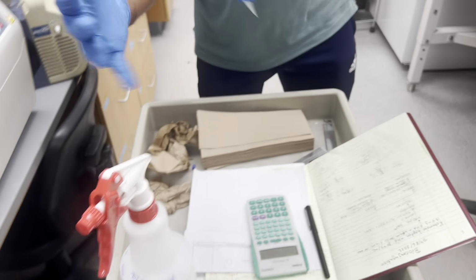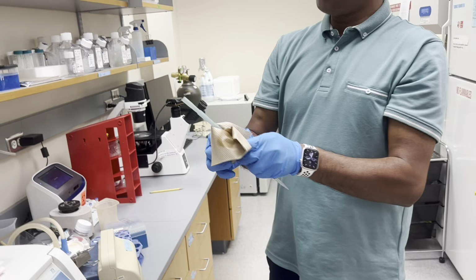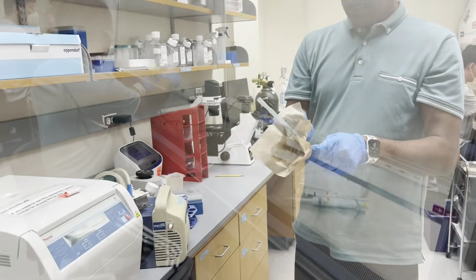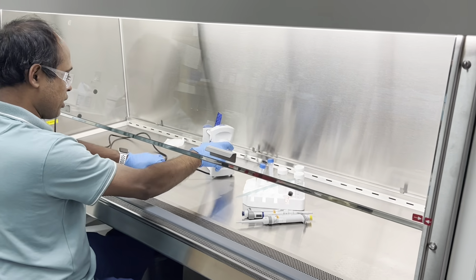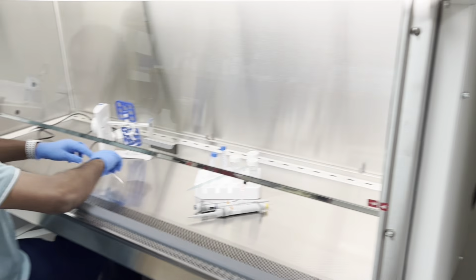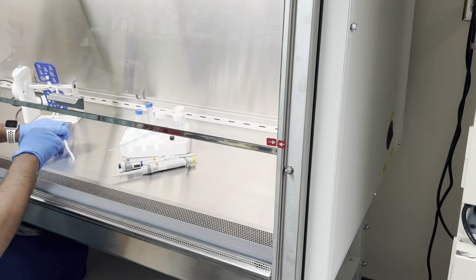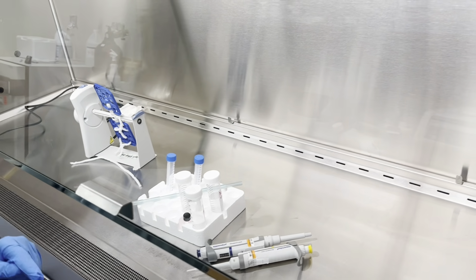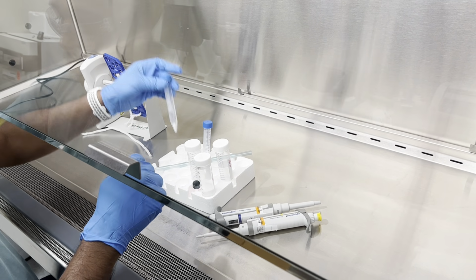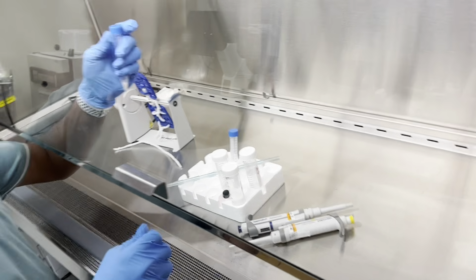Normally there are sterile ones, but here it worked. Now it's just the additions, right? Yeah, so now we have taken those two solids here, combined, both solids together.